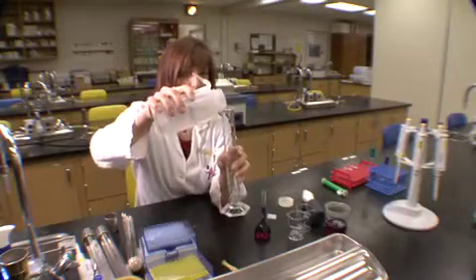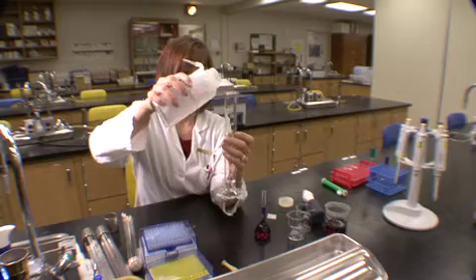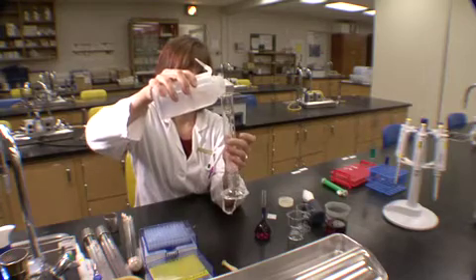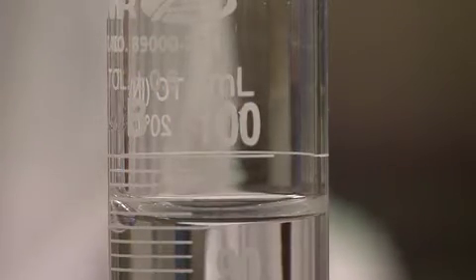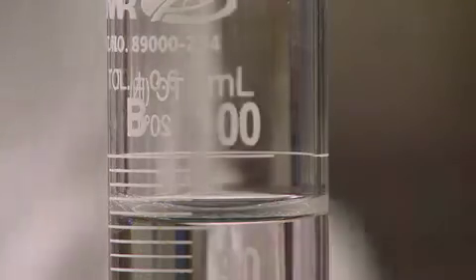To start, we will go over a few ways to measure large volumes. A graduated cylinder is versatile as they come in an array of volumes, and each size can measure a wide range. To start, you should determine the volume desired, and you can quickly pour around 90% of that volume into the cylinder.